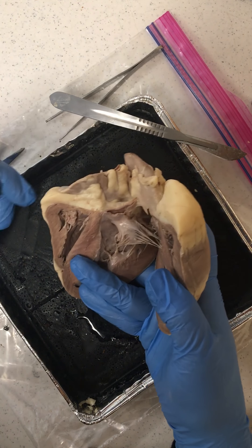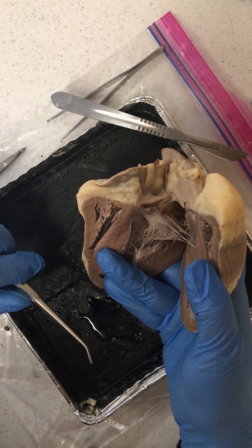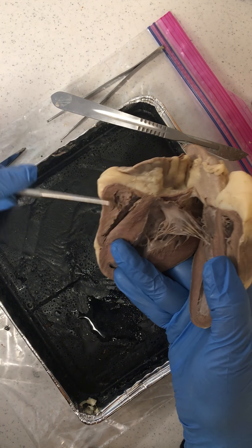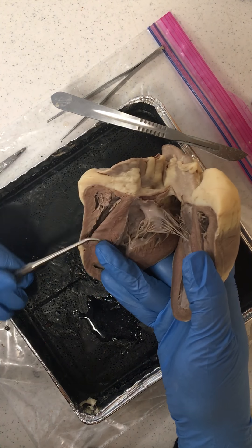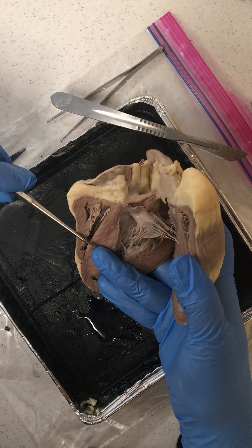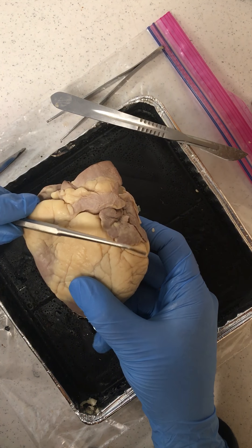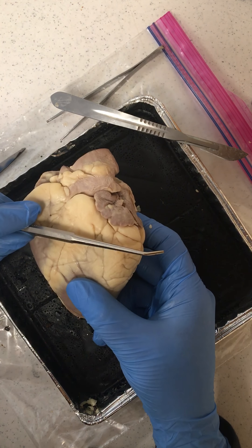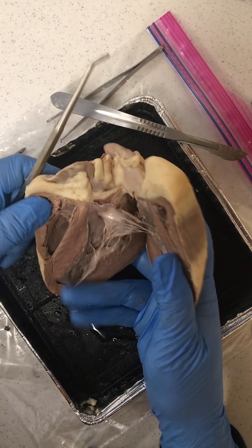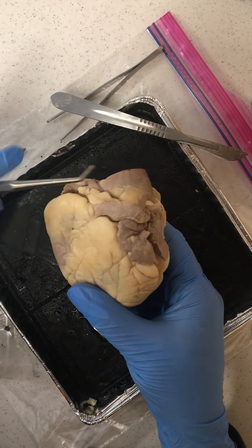So again, blood flows in through the right atrium, where we receive deoxygenated blood from the superior vena cava, the inferior vena cava, and the coronary sinus. That blood passes through the tricuspid valve into the right ventricle — the tricuspid valve prevents backflow. Blood then goes up through the pulmonic semilunar valve, which again prevents backflow into the right ventricle, and out through the pulmonary trunk to the lungs via the left and right pulmonary arteries. It becomes oxygenated, returns through the pulmonary veins into the left atria, through the mitral valve, into the left ventricle, and is forced out through the aortic semilunar valve and out through the aortic arch.